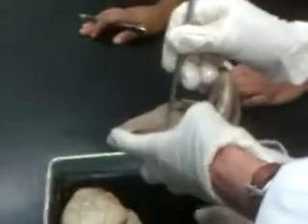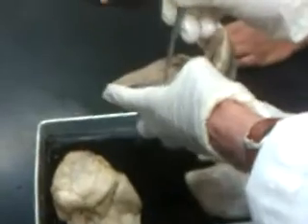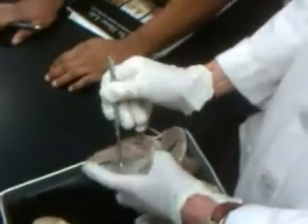So let's take this for example. This is going to be what valve? Is that the right side? No, that's the left side. That's the bicuspid. Bicuspid.